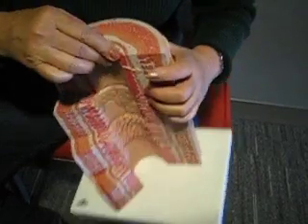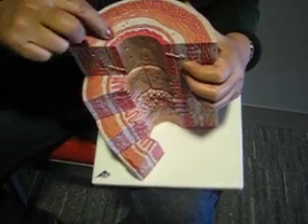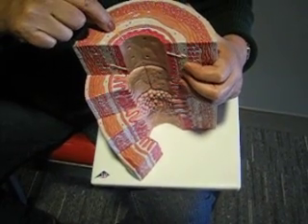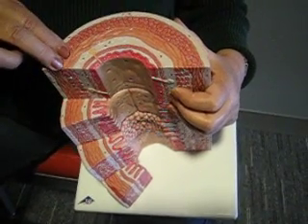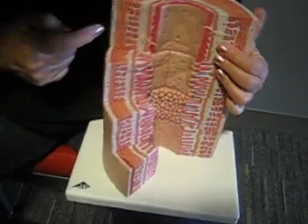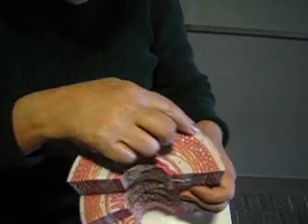Then we have a lamina propria underneath it, and muscularis mucosae, a little thin layer of muscle. Then we have the submucosa, which you can see some glands here, blood vessels, and then 2 layers of muscle, the muscularis, okay? Circular muscle and longitudinal muscle. And then the outer portion is called the adventitia.